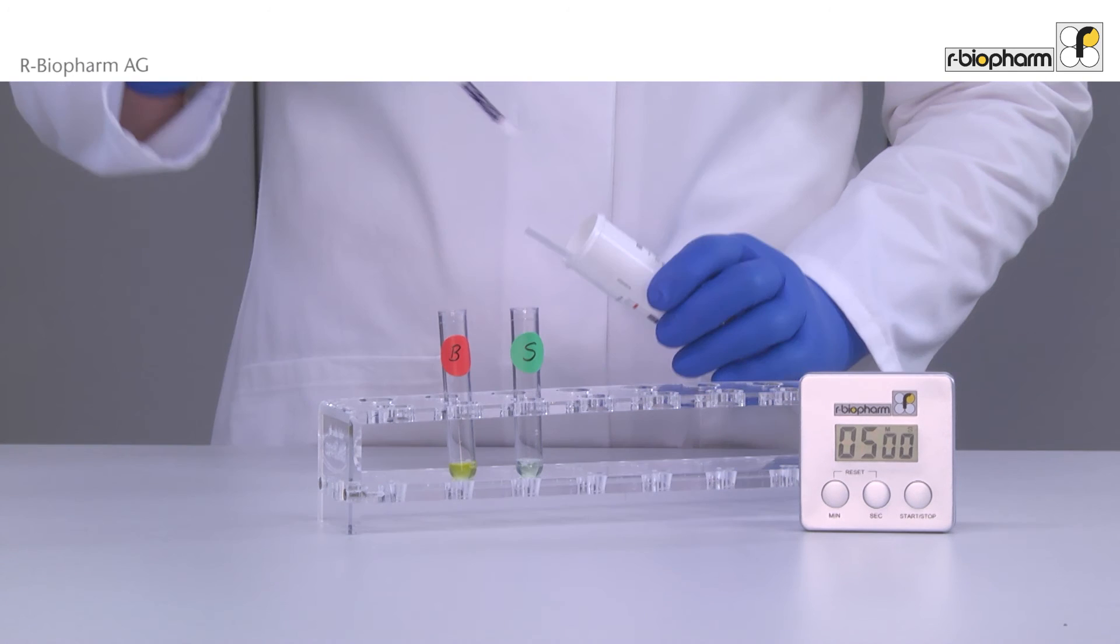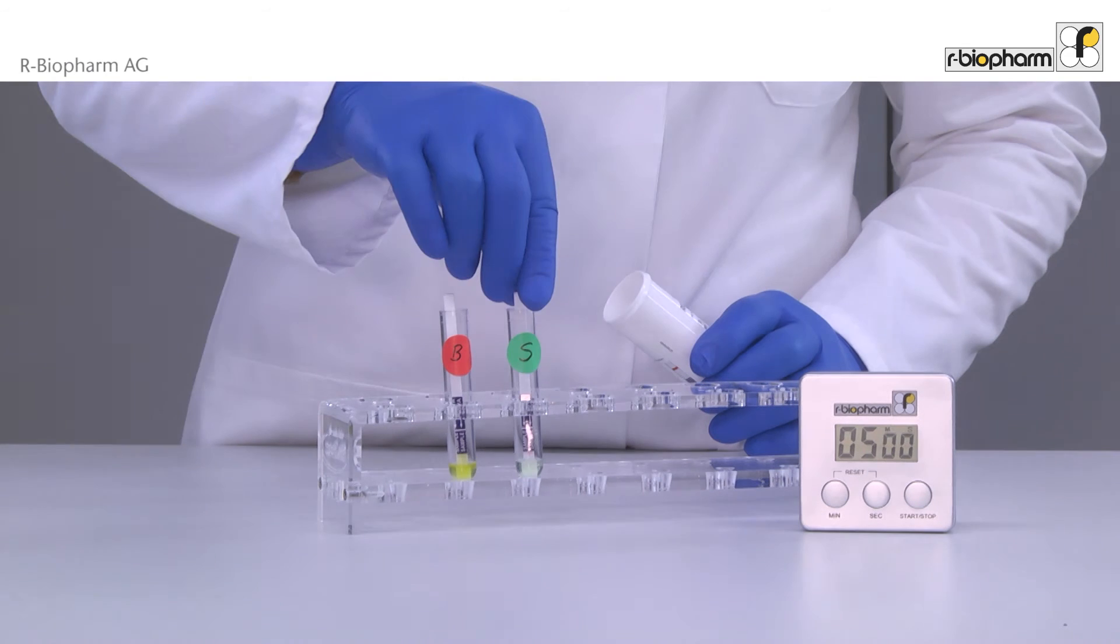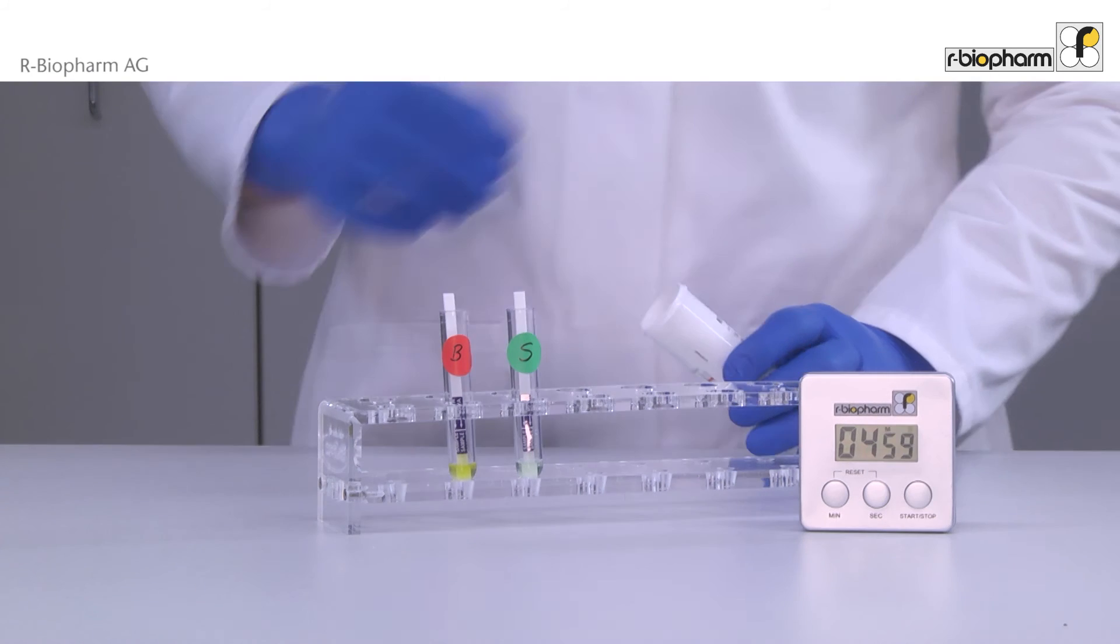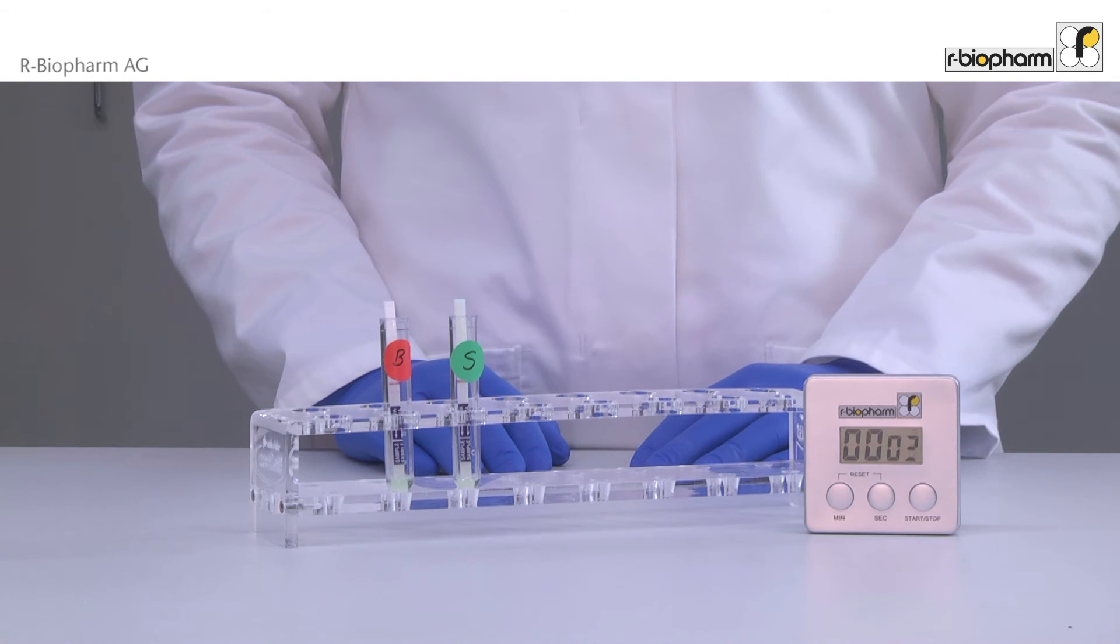Use gloves while placing the dipstick vertically with the arrow end into the test tube. Incubate the strips for five minutes.